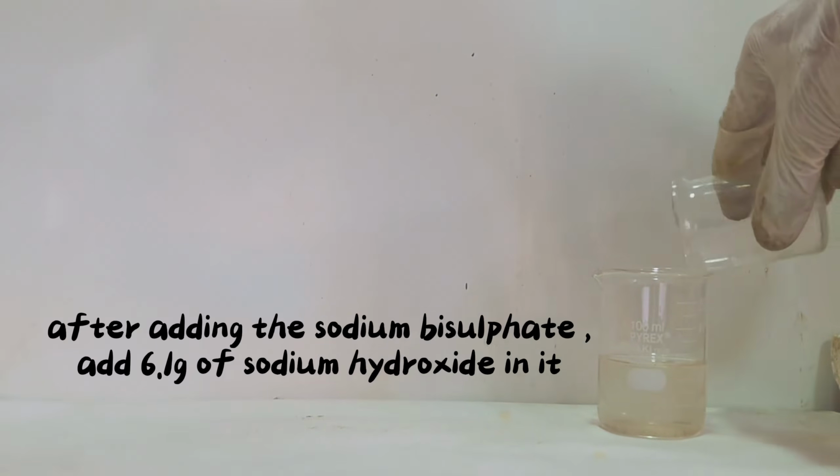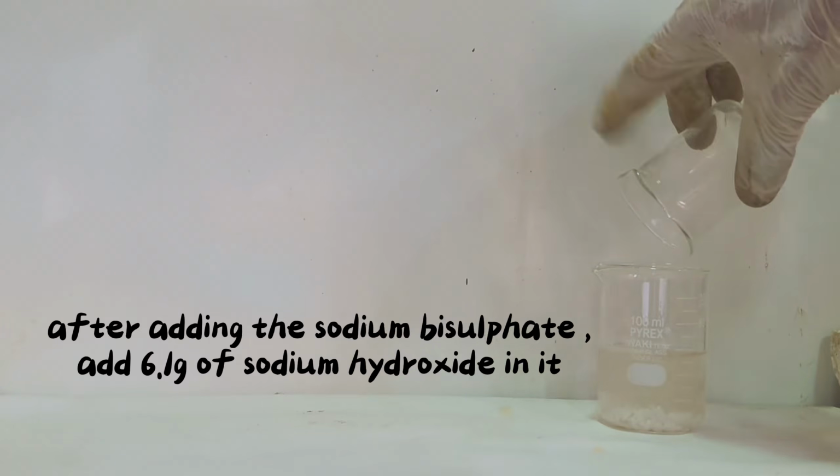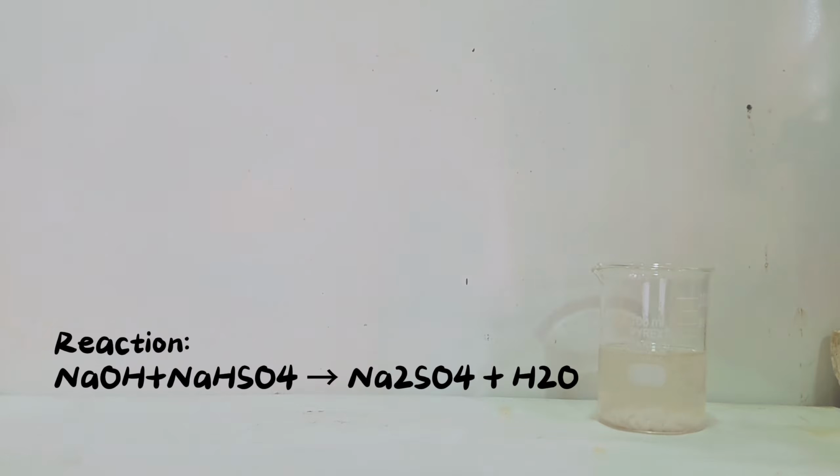After adding the sodium bisulfate, add 6.1 grams of sodium hydroxide in it. When sodium hydroxide reacts with sodium bisulfate, they undergo a neutralization reaction, producing sodium sulfate and water.